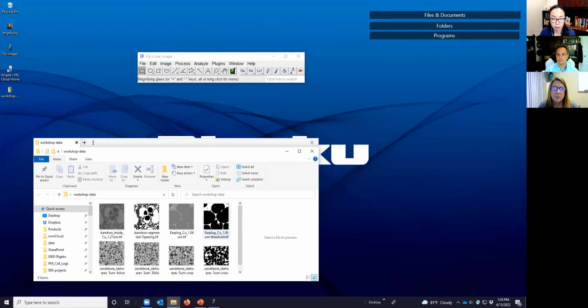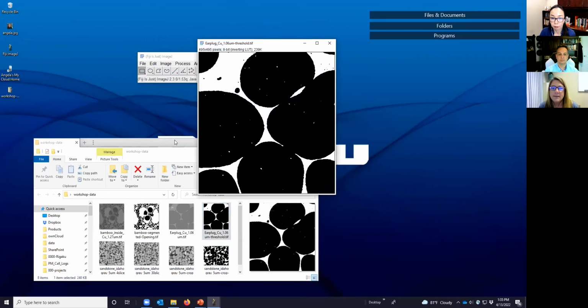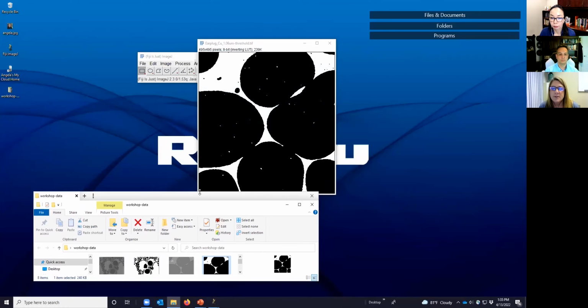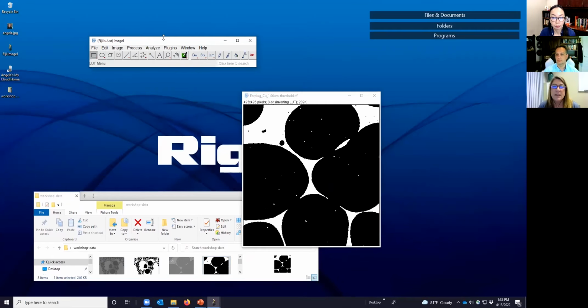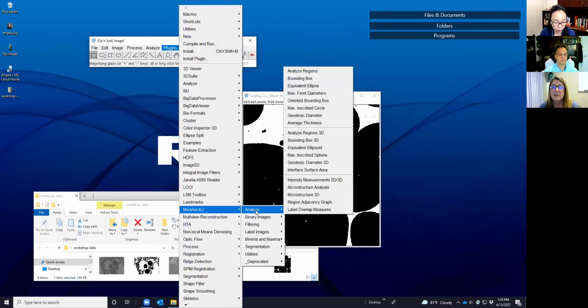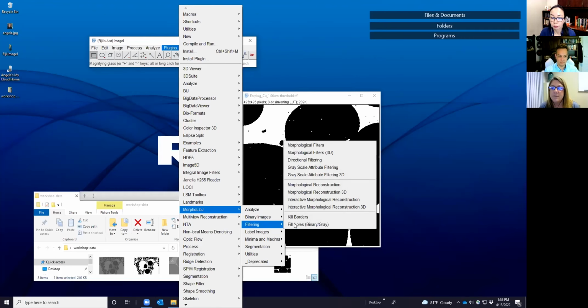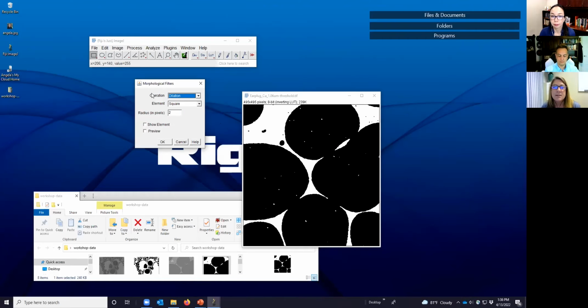All right, so the first thing we're going to do is look at our earplug example. In this case, we're going to look at the morphological operations that I showed you. First, dilation and erosion. To use the plugin MorphoLibJ, you go to Plugins, MorphoLibJ, and you can see there's lots of different features available. We'll just be talking about a few of them today. We're going to go to Filtering, and at the top, you see Morphological Filters. We'll click that, and it opens this window.